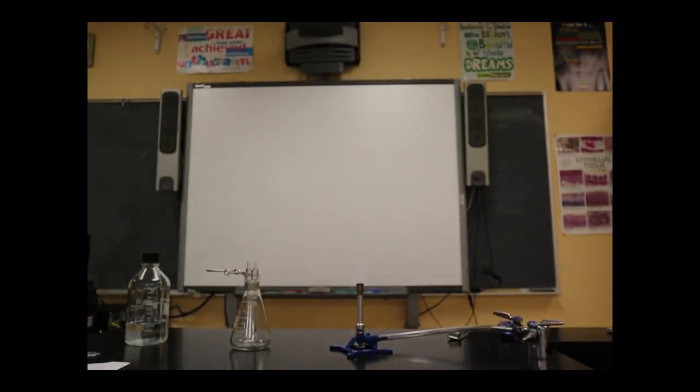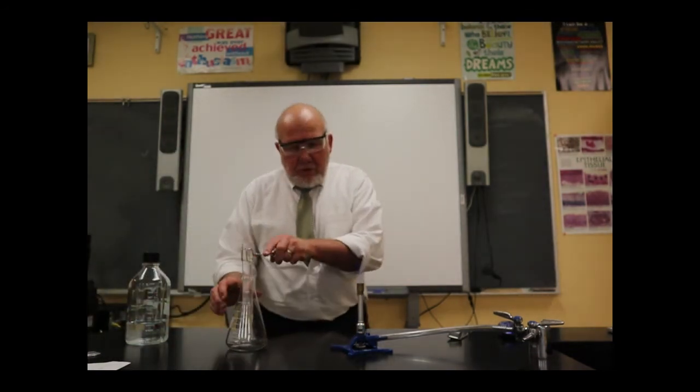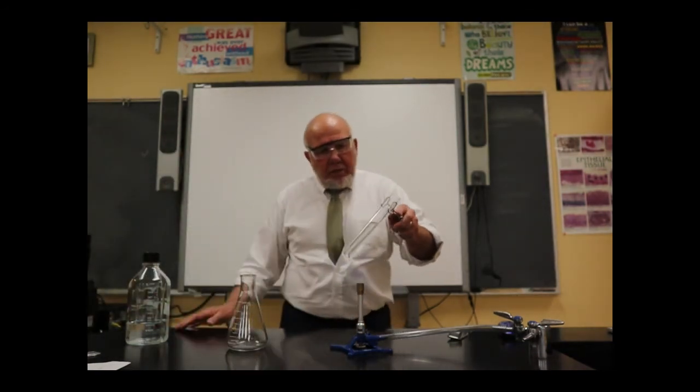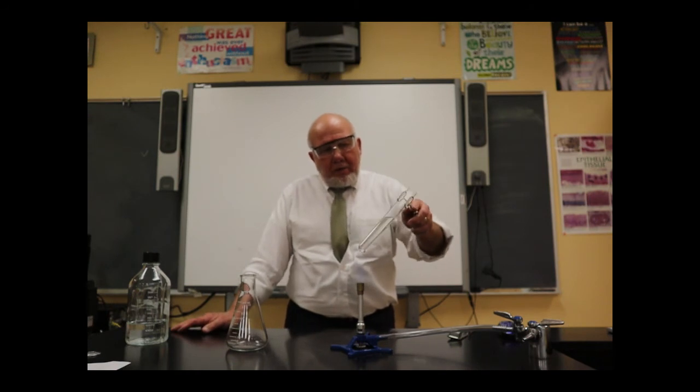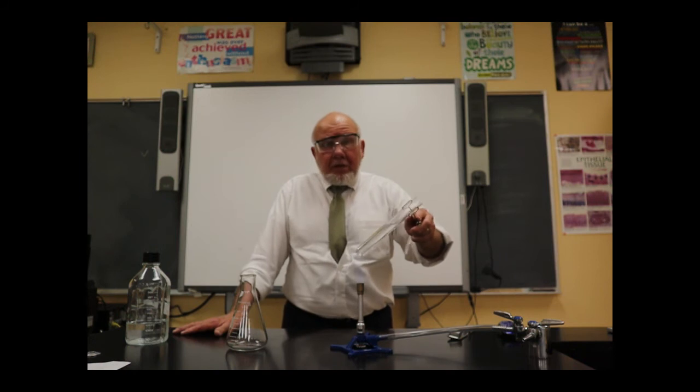And this one, see here, it looks a little out of focus to me. There we go. Sharpen up my image a little bit. All right. So what I want to do is very carefully hold it above the flame, and just move it in and out of the flame. I just want to heat it. I want to try to prevent it from splattering. This is going to take some time because that's quite a lot of liquid.